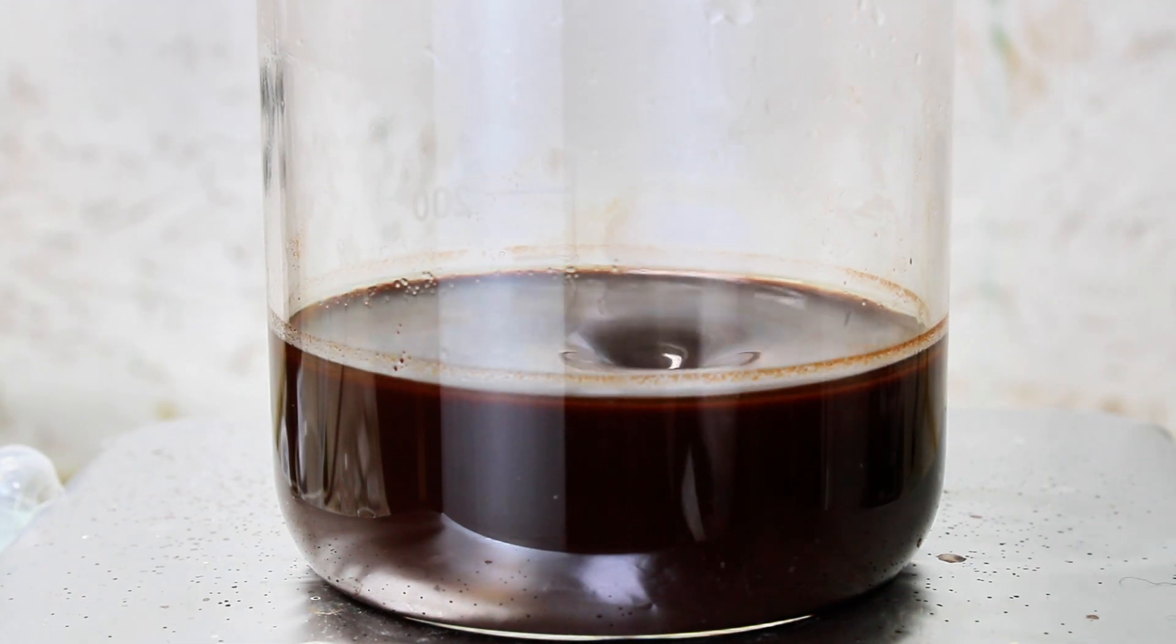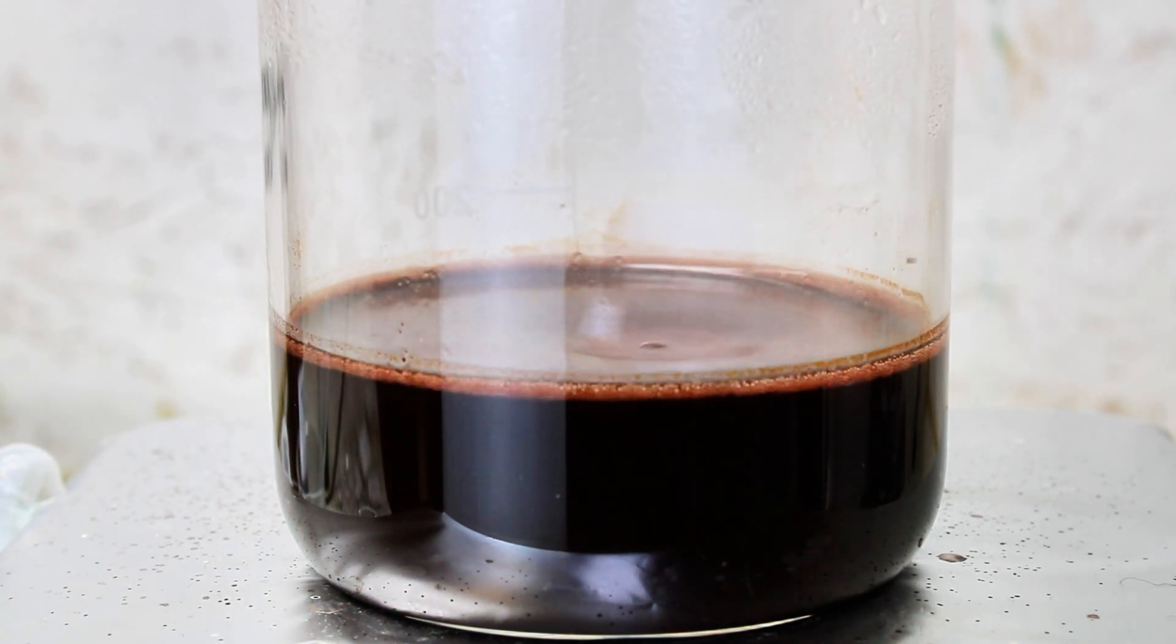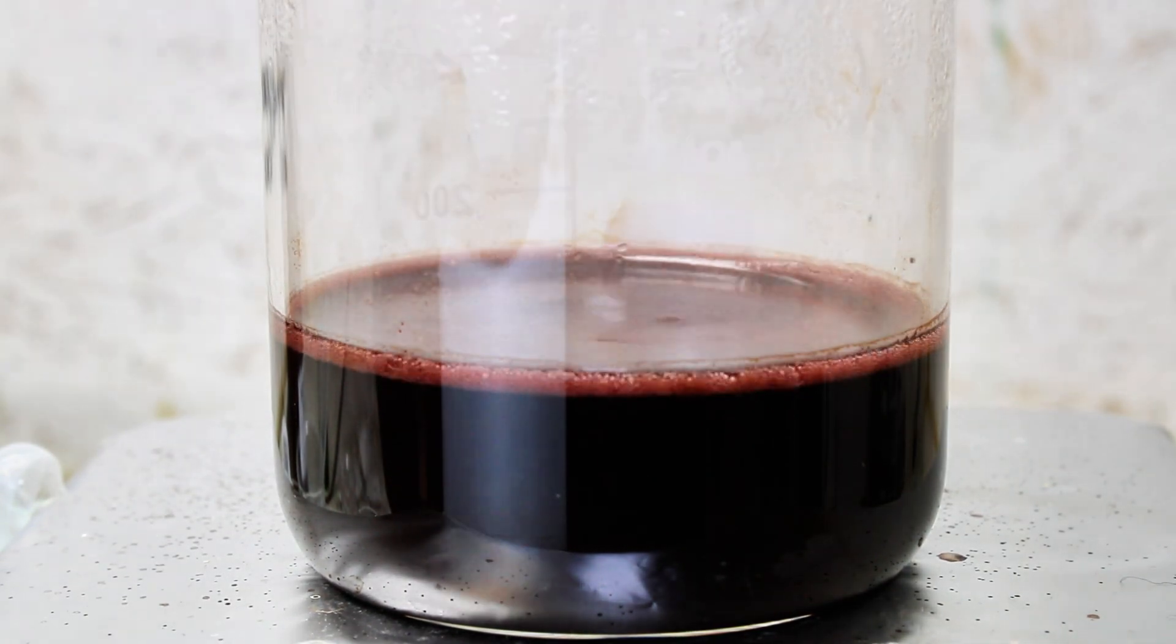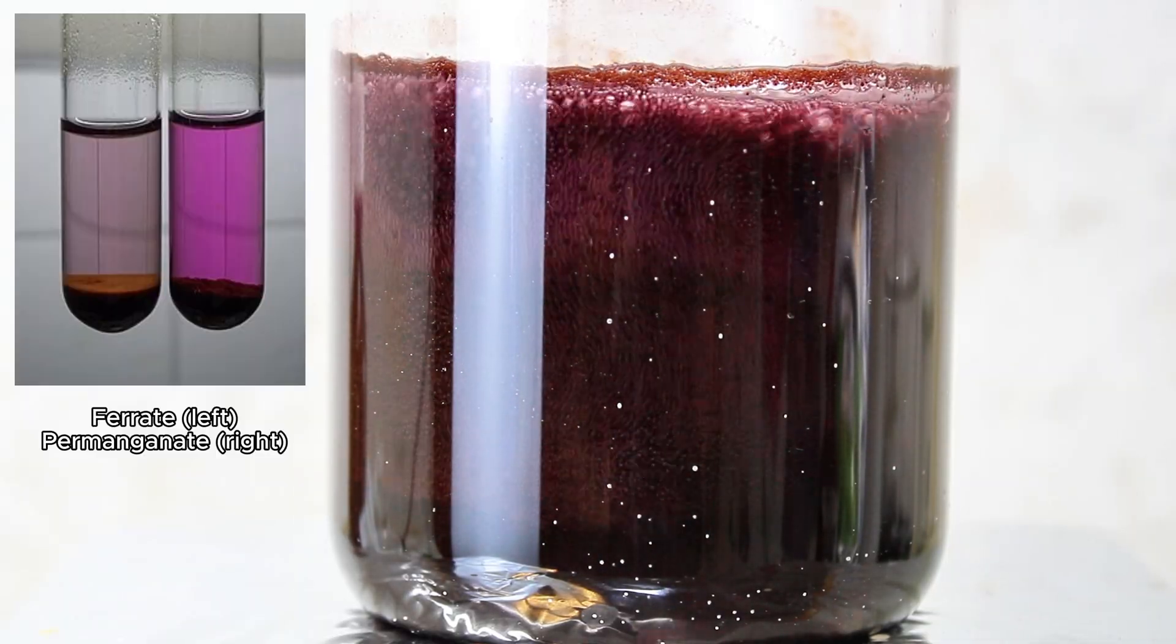The ferrate ion is actually one of the strongest known water-soluble oxidizers and is significantly more oxidizing than the permanganate ion. It even looks somewhat similar to permanganate in solution, but in my opinion it's more redshifted and notably less vibrant.